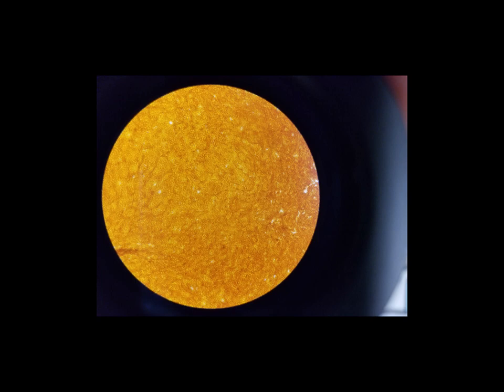And I don't see any in this example, but it's common to see various types of white blood cells, especially macrophages and things like that in this tissue. But as a general rule, when you see the nucleus here and there, really what you're looking at are fibroblasts. And again, those are what make those reticular fibers.